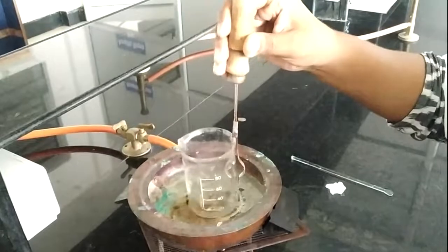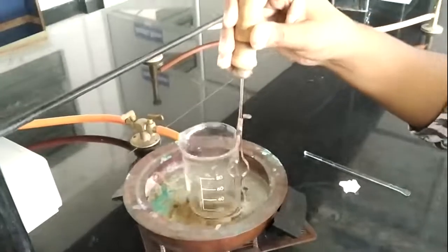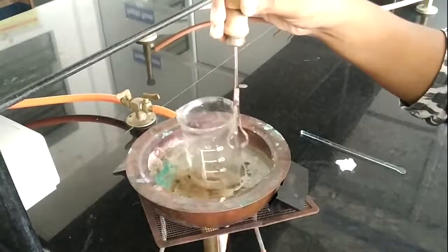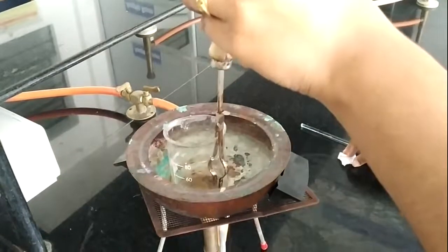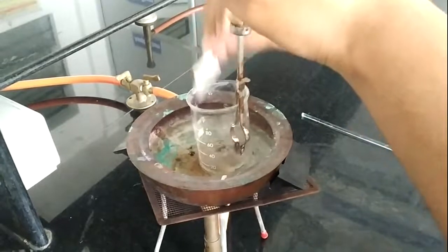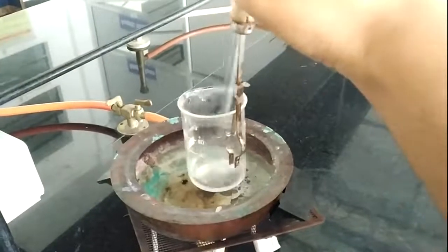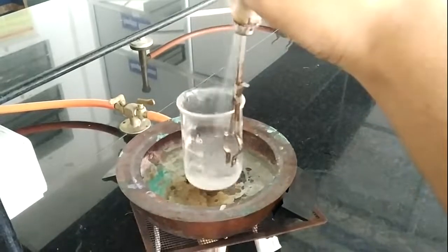After adding glycerine to the solution of water and gelatin, we will wait until the temperature reaches 100 degrees Celsius. Once the temperature reaches 100 degrees Celsius, I am going to add this gelatin-glycerine solution into the previously sifted zinc oxide, which was passed through sieve number 85, and stir it properly.